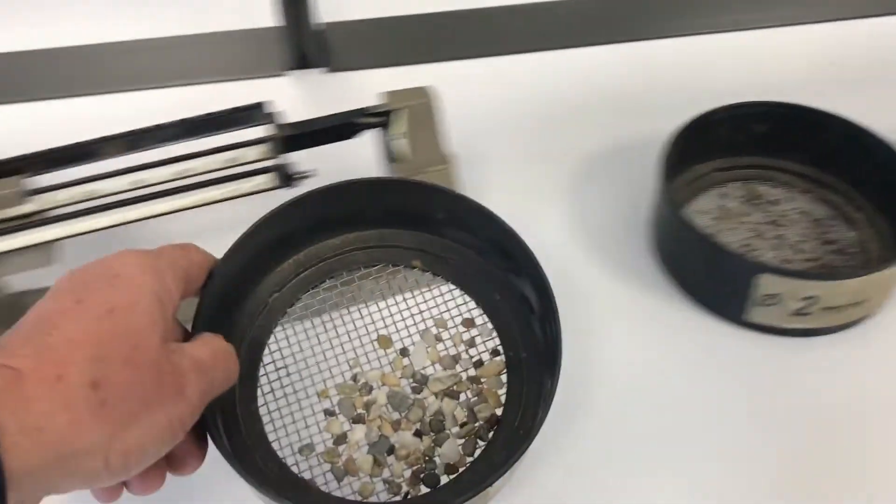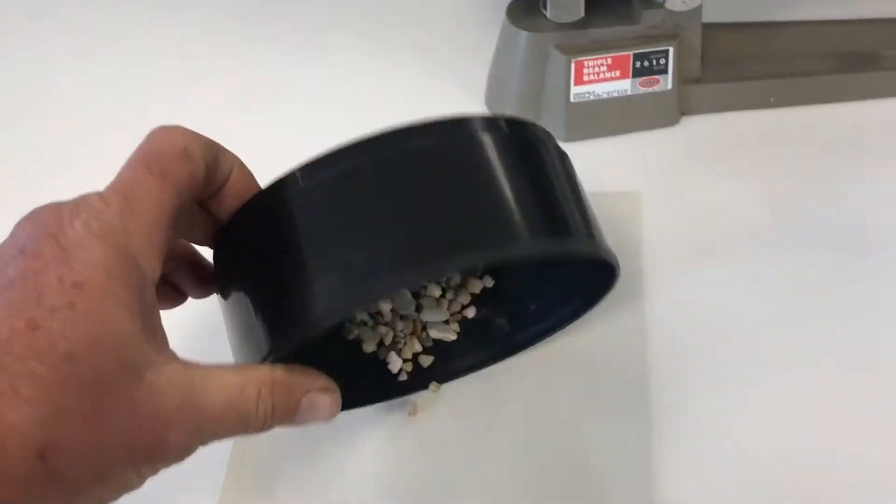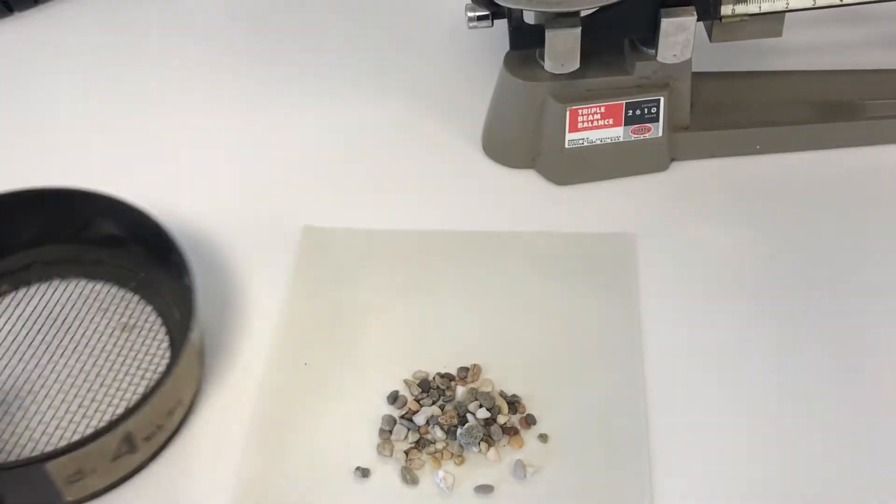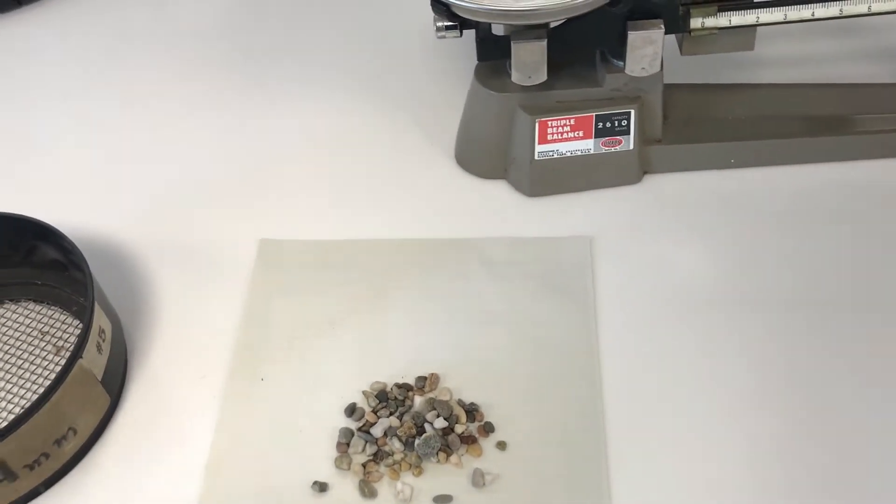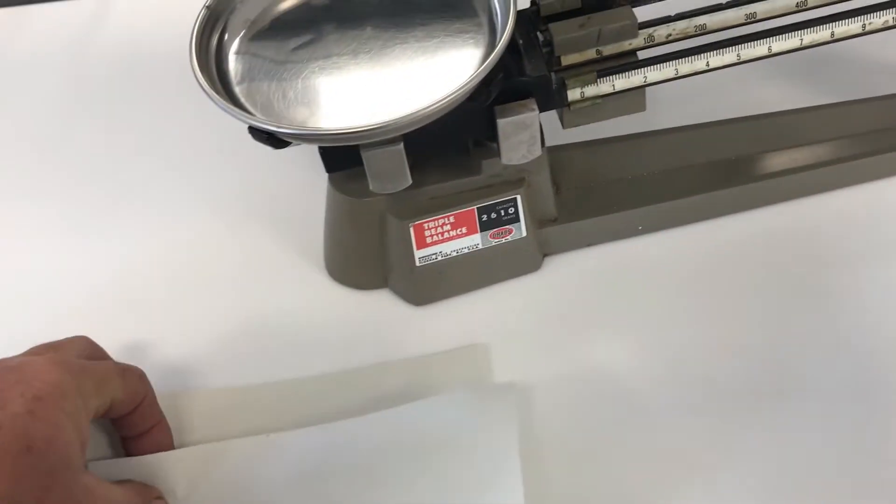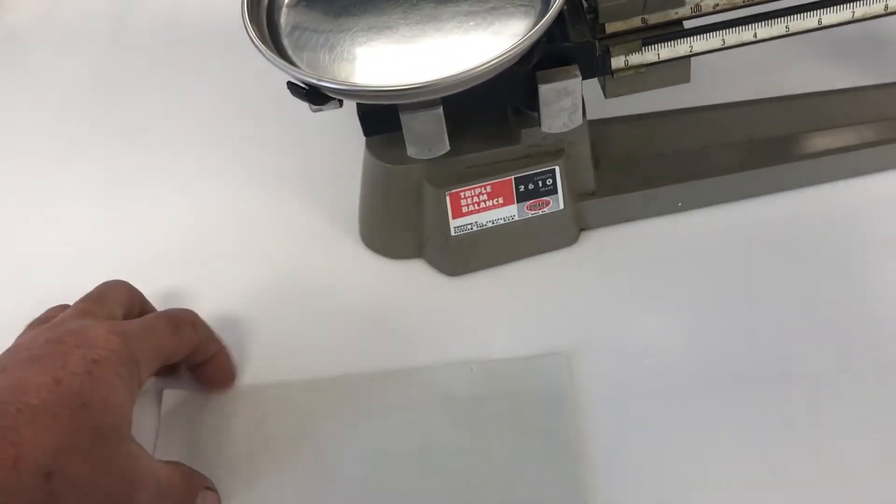Okay, and then we have to know how much is that, so we weigh them. Just we pour in a piece of paper and we transfer to the balance. And this is an ordinary balance, of course.